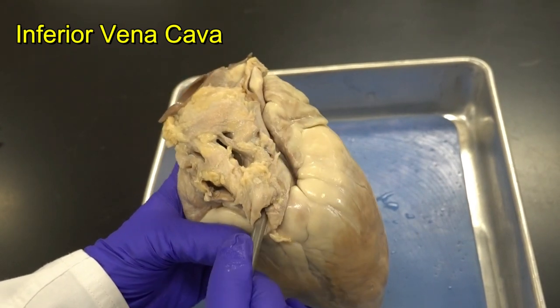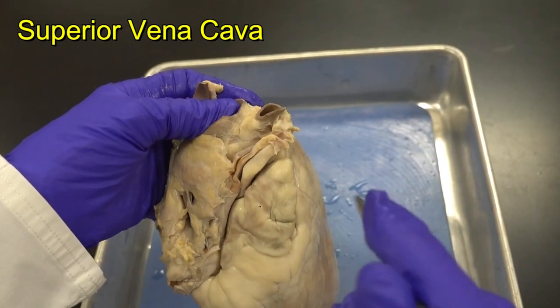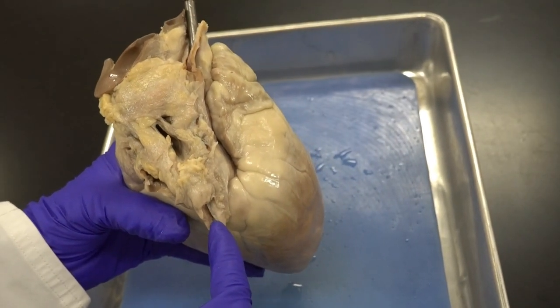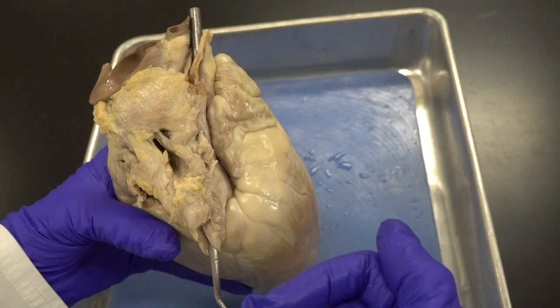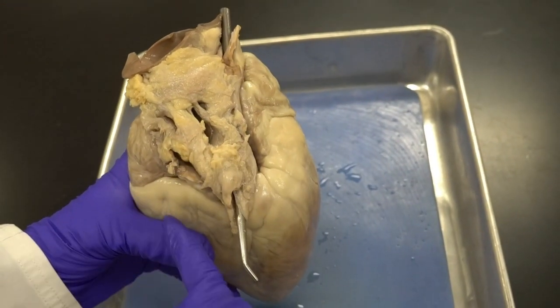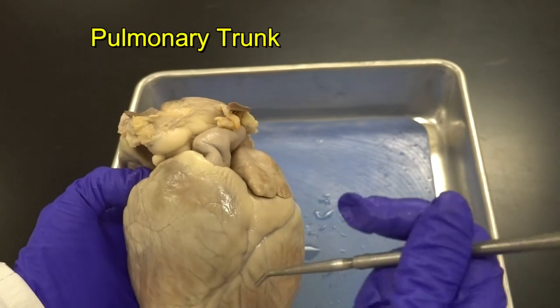Here is a small section of the inferior vena cava — when I place my instrument it goes inside the right atrium. For the superior vena cava I look for a collapsed blood vessel; when I insert my instrument it exits through the inferior vena cava, confirming the instrument passes through the right atrium. These two vessels — superior and inferior vena cava — send deoxygenated blood from the upper and lower parts of the body into the right atrium, along with the coronary sinus.